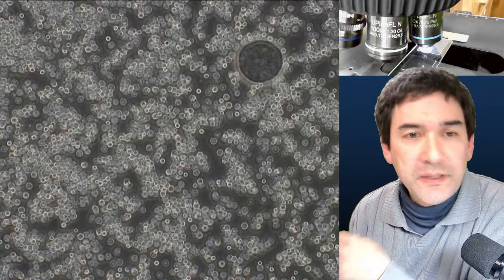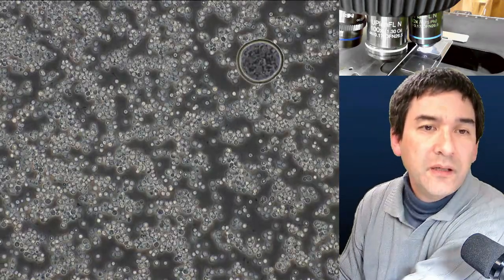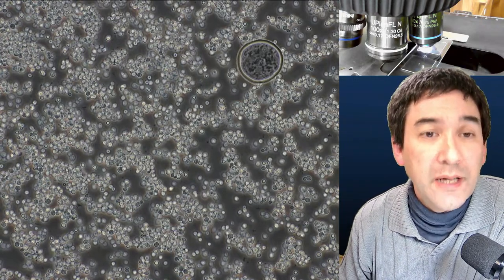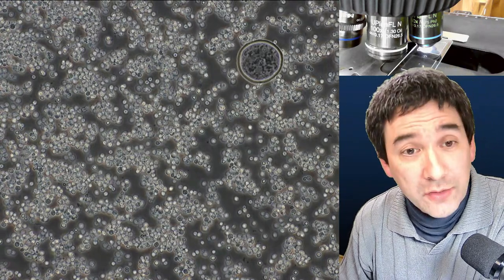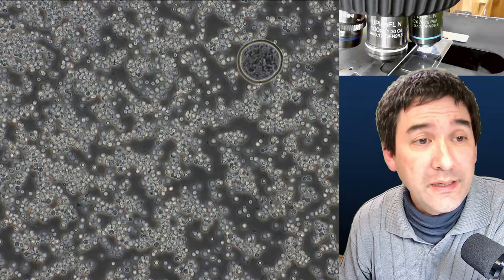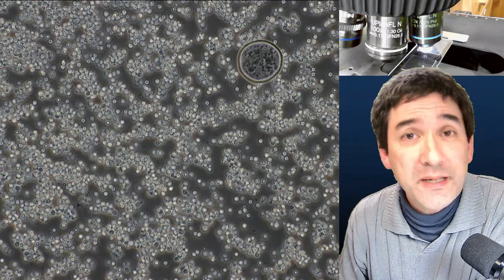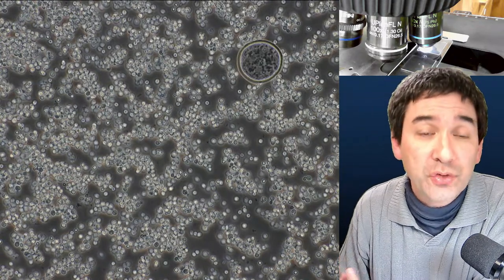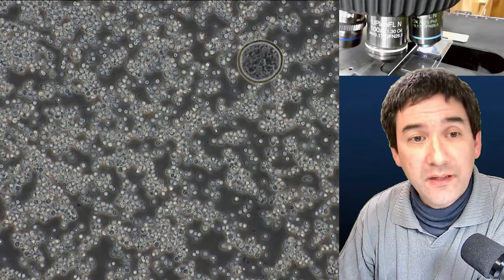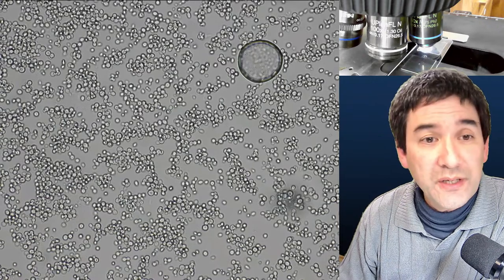With a thinner, more spread-out specimen this is much better — very typical for phase contrast. The yeast cells here appear brighter on a darker background. The bacteria earlier appeared darker on a brighter background — this depends on whether the refractive index of the specimen is higher or lower than the surrounding medium. Here is phase contrast, and closing the condenser gives regular bright field.